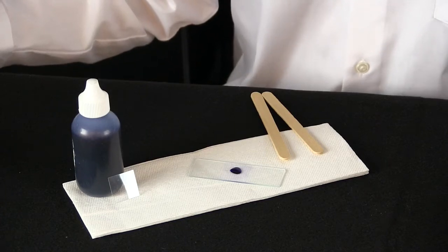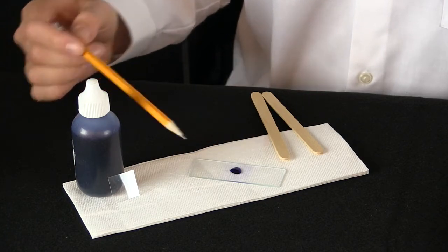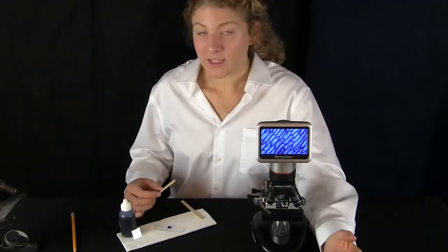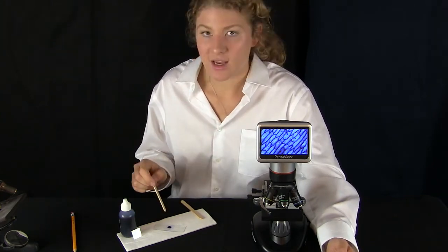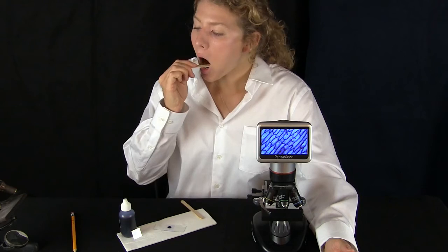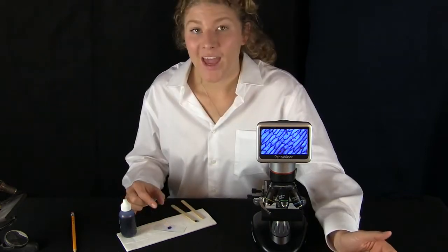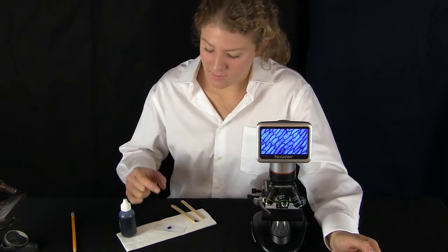The best way to do this is to take a look at the cells on the inside of your cheek. But remember, don't do this at home by yourself — only do it with the help of an adult or teacher. We're going to need some popsicle sticks, a slide which has some blue stain on it, and a cover slip to cover the stain and the cells to put it onto the microscope. To collect my cells, I'm going to take this popsicle stick and rub it on the inside of my cheek, and then dab it gently into the stain.